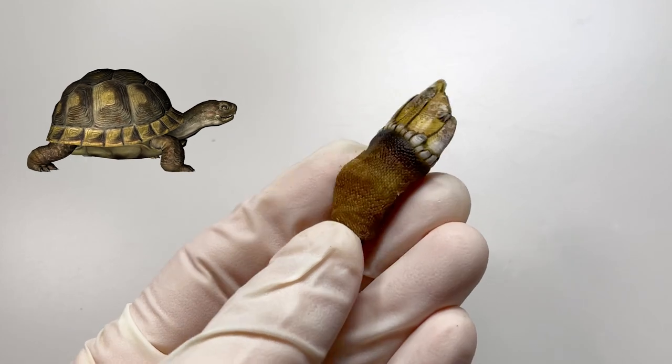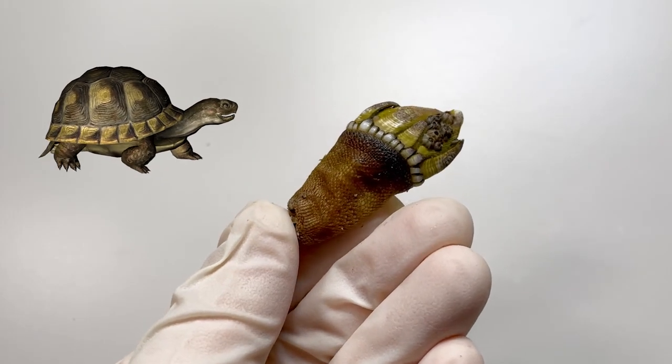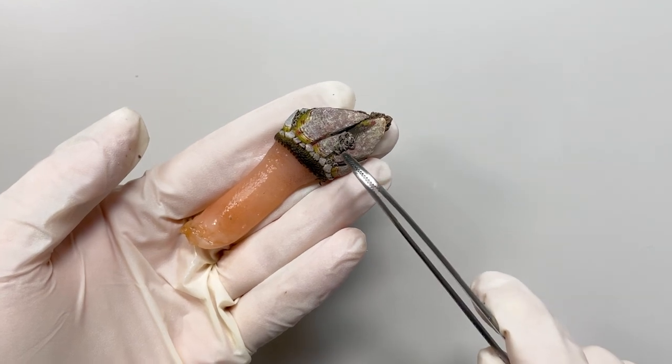Here's a creature that looks like a turtle's hand. What is this creature?